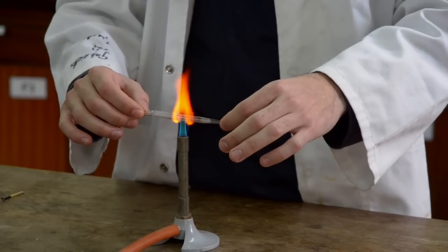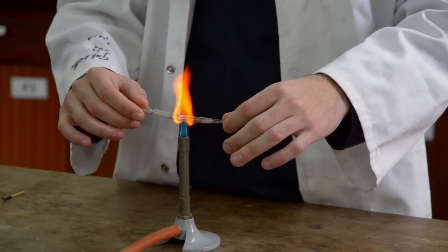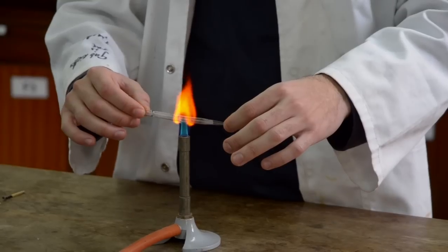When the middle part is hot enough, it will become pliable. Pull the ends apart quickly and smoothly.